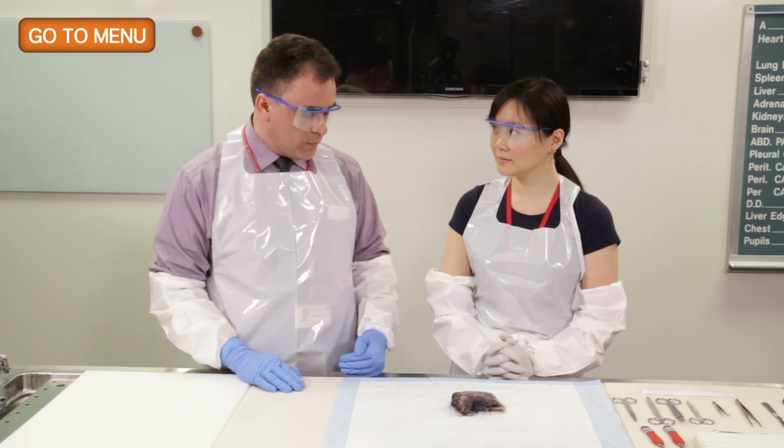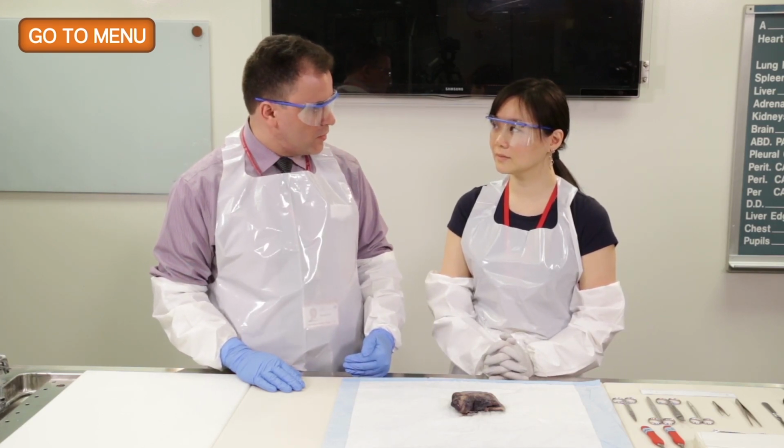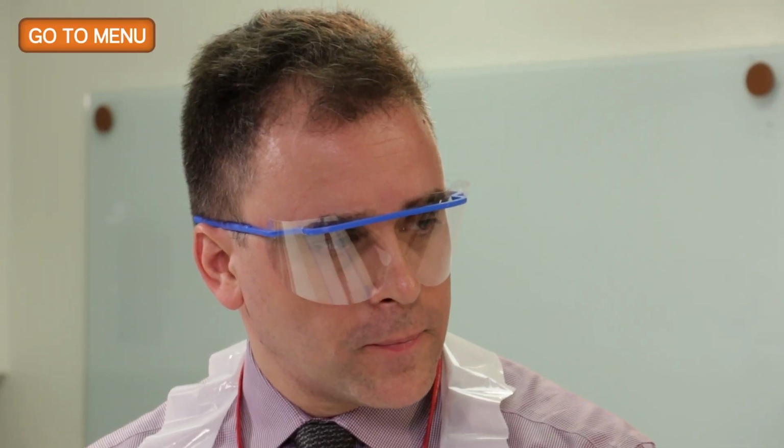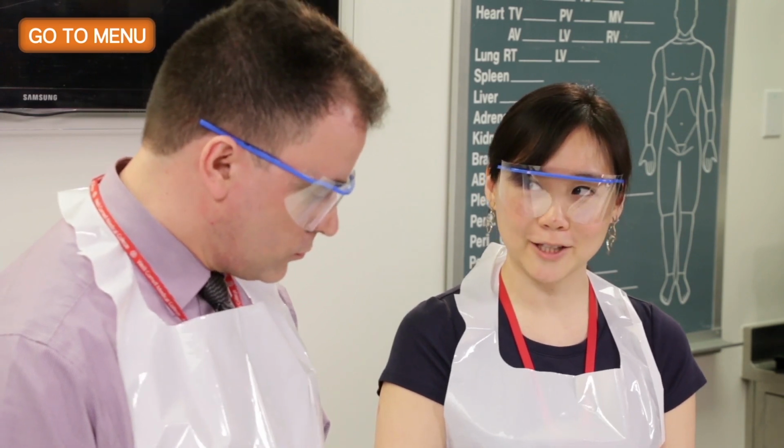And for example, if we had found out that this was in fact a pneumonectomy specimen, how would that have impacted things? Well, a pneumonectomy specimen would entail, I would think, a completely different history, and maybe the tumor was just proximal, and that was the only surgery that was available to them, or a lymph node that was actually positive. So I would think that the history is quite vastly different from what we have here.